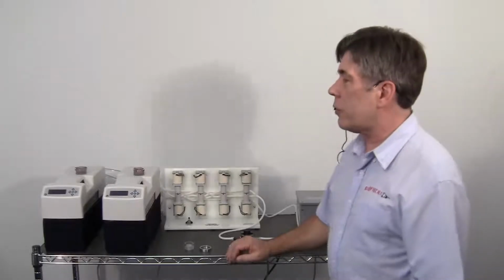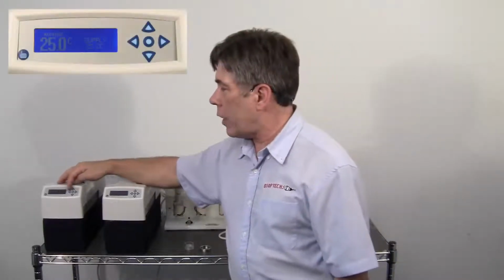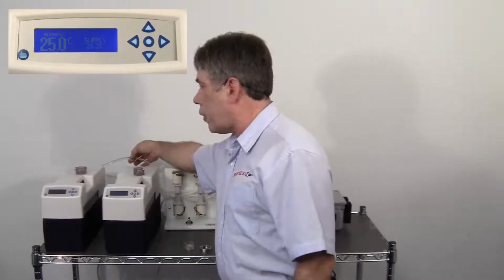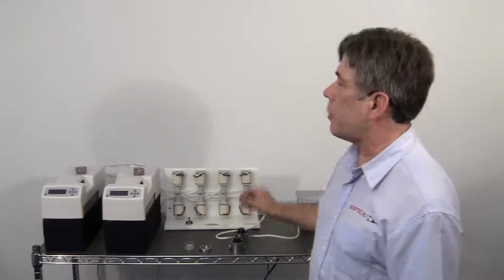The way we've done this is to set up two nanotherm systems. The nanotherm system, as I'm showing here, is a Peltier-driven device with a fluid reservoir and a recirculating pump, all together under the control of a digital processor. This allows you to set the temperature that you want in the fluid flowing from and to the system into a separate device. In this case is our little worm embryo chamber.